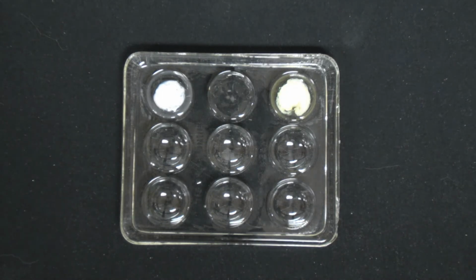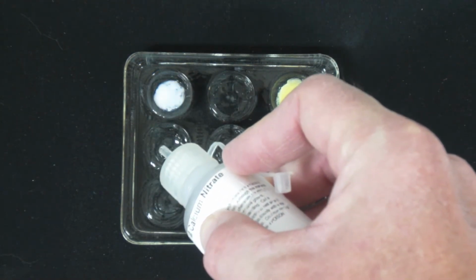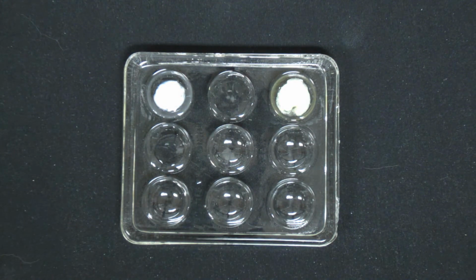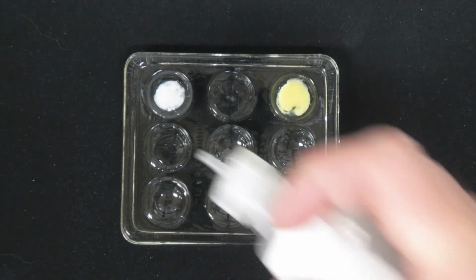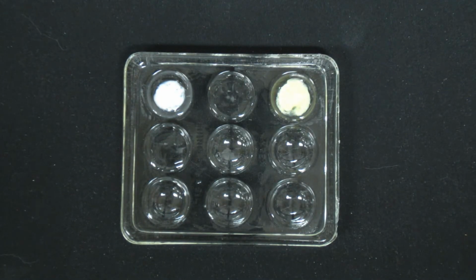The fourth one is starting off with calcium nitrate. And by the way, it doesn't matter which order I add the reactants. Like for this one, I could just as easily have added the sodium chloride first, and you would see the same observation. Okay. But I'll take it as I see it. And like I said, the second one now is sodium chloride. Now what you're going to see here, again, there's no reaction taking place in this solution when these two solutions are added.